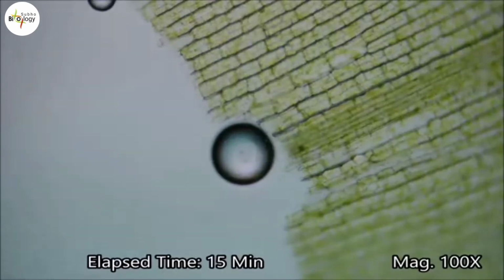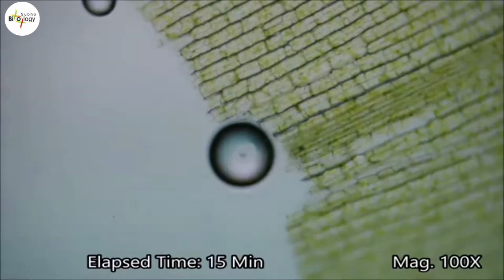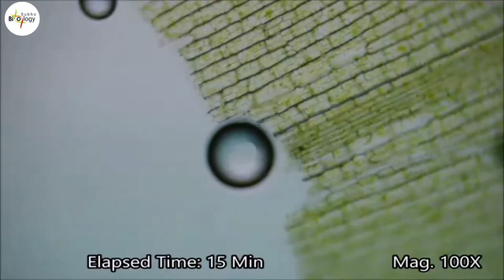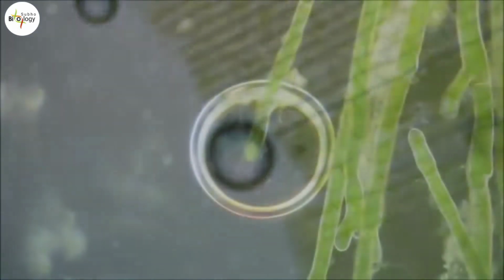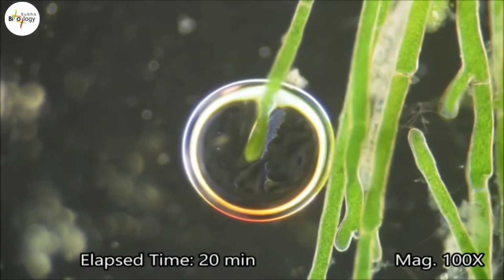Here we can see an oxygen bubble growing and the chloroplast in the plant cells moving around. We see a lot more oxygen bubbles than carbon dioxide bubbles for a few reasons.